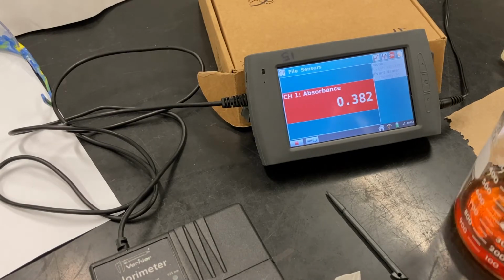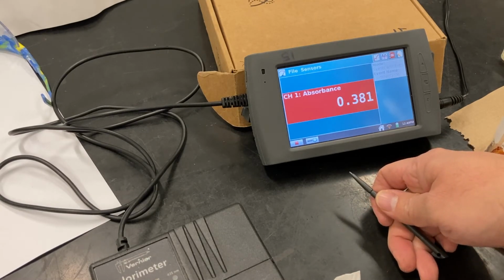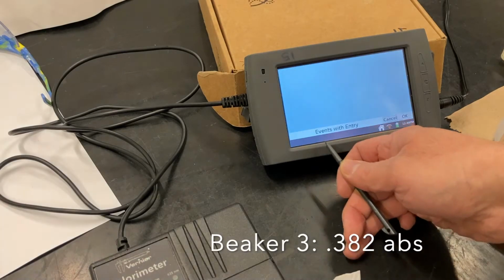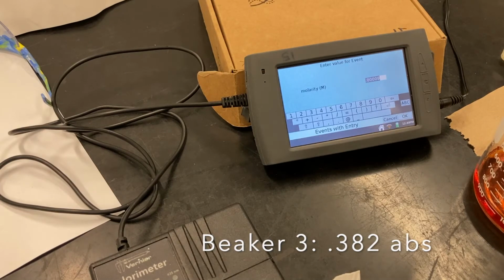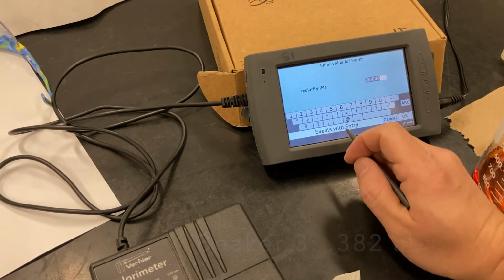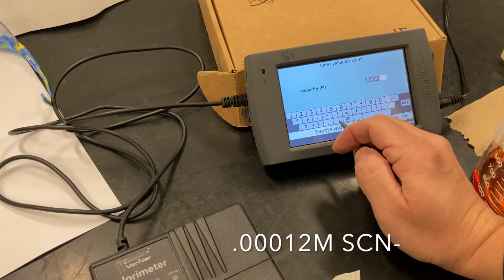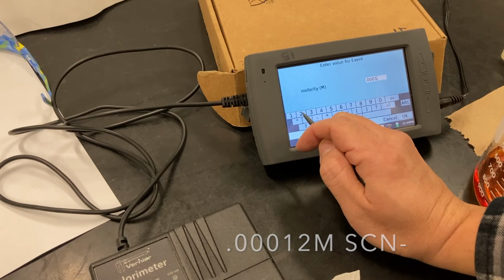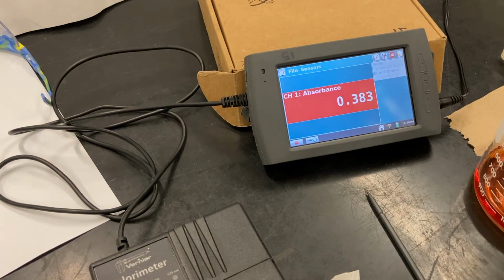Okay, so it looks like 0.382. Let's keep that. Concentration is 1.2 times 10 to the minus 4, or in other words, 0.00012. All right, on to solution 4.